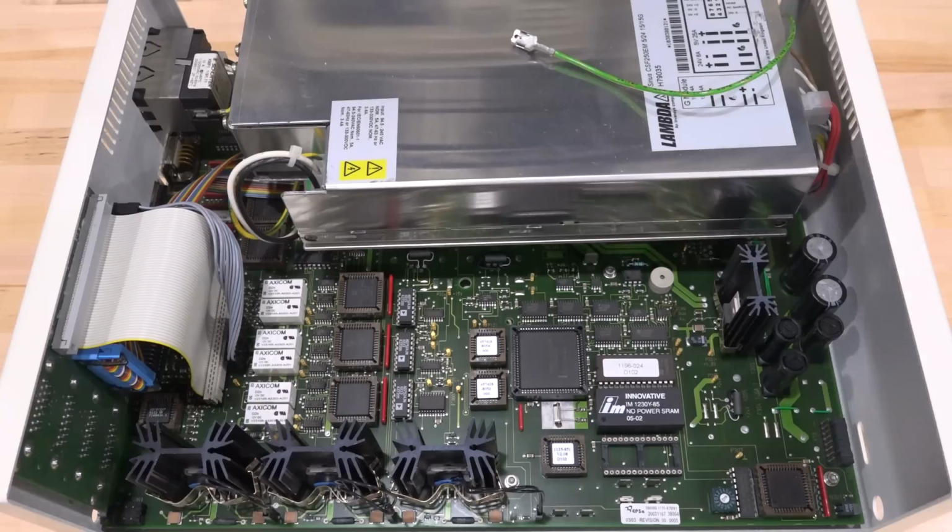This has a lot of flexibility. You can set different PID parameters, the acceleration of the motors, all different kinds of soft and hard limits on how these motors move around. Really totally customizable with the appropriate software commands. I had to figure all that out.